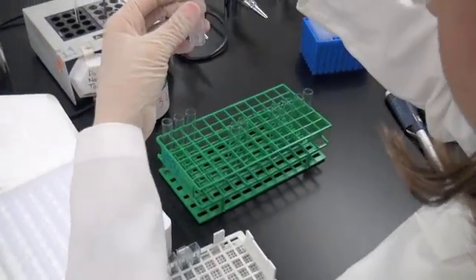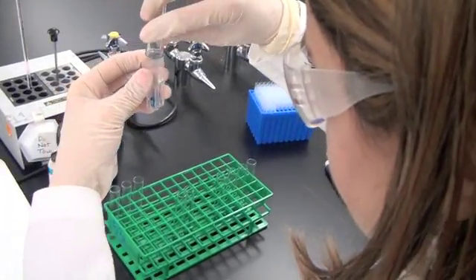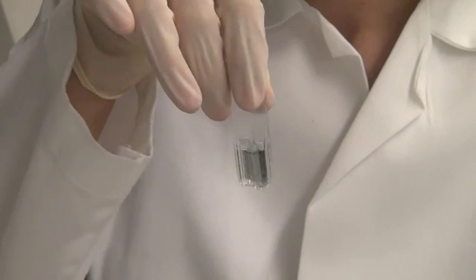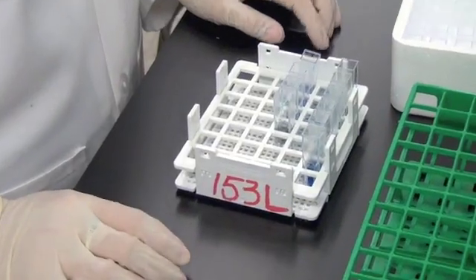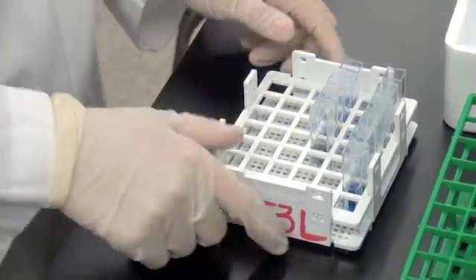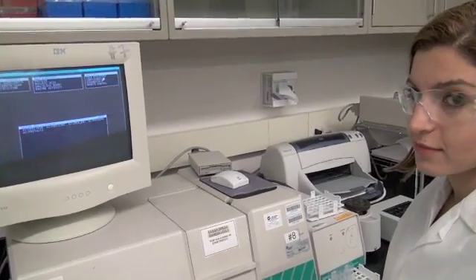Now, pour the samples into the cuvettes. These cuvettes are called microcuvettes because their capacity is meant for volumes less than one milliliter, basically volumes in the microliter range. Then carefully bring the samples to the spectrophotometer.